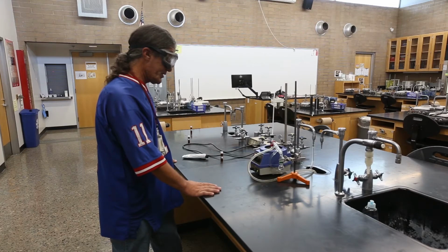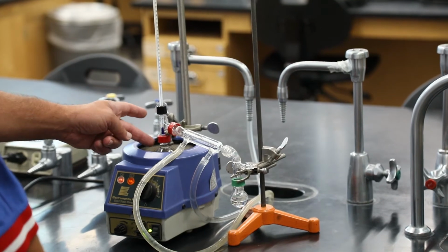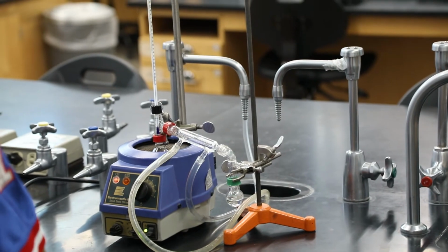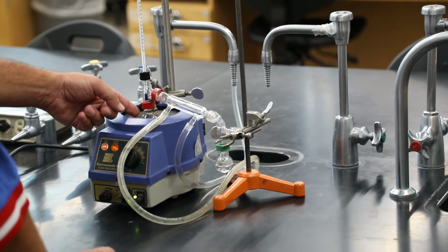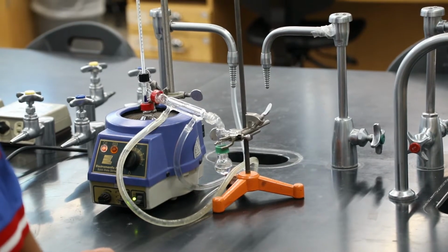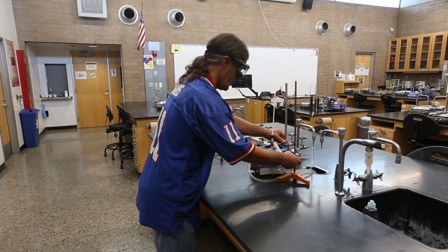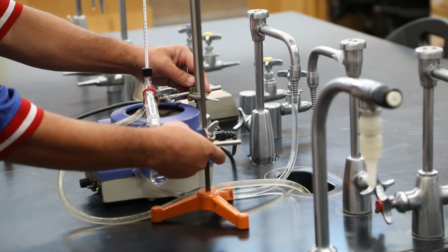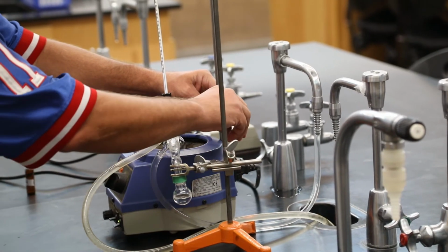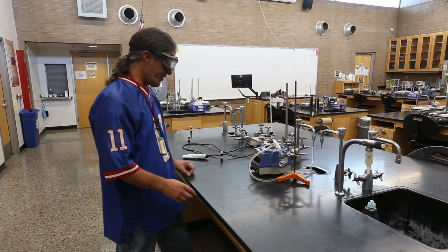A lot of times, if you really want to stop it quicker, you're going to take it out of the heat by raising the whole apparatus off. Be careful when you do that, because if it says it's boiling at 120 degrees Celsius, that is way above boiling water temperature, so you're not going to want to touch anything that's that hot. So if I wanted to raise this up, I would touch the clamps, loosen the clamps, and raise it up that way. And that way I wouldn't be touching any of the hot glassware. So if I wanted to reduce the heat and stop the boiling here quickly, I'm going to want to get it up out of the heating mantle.